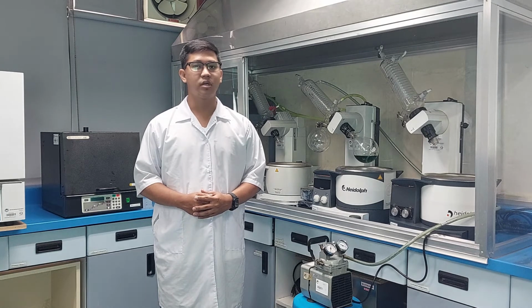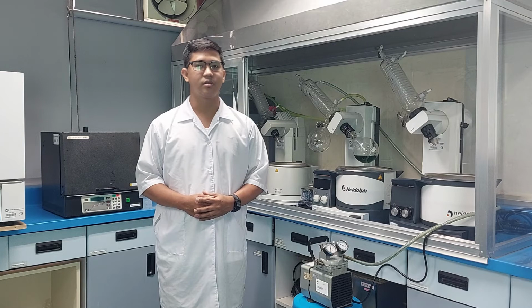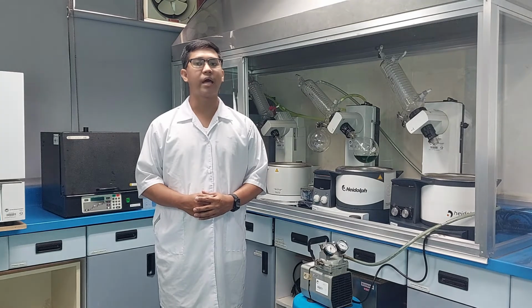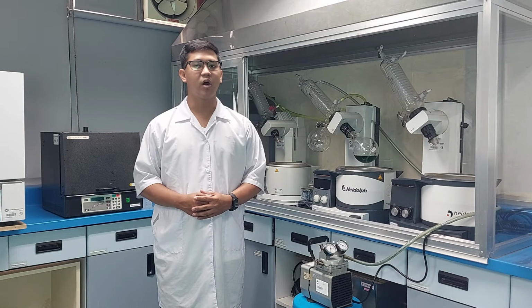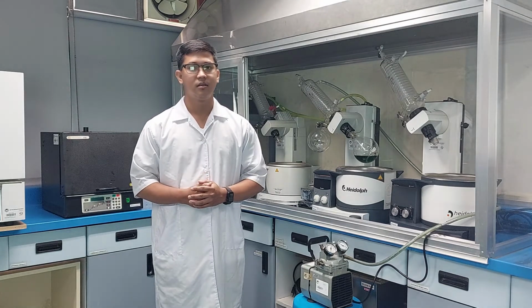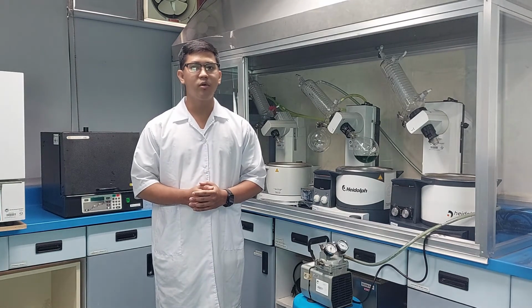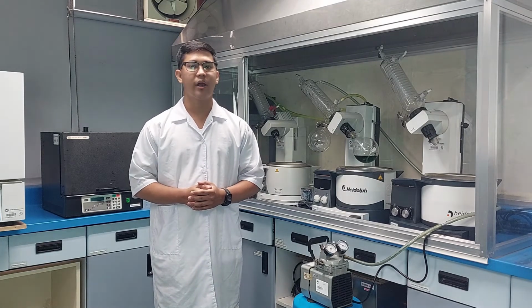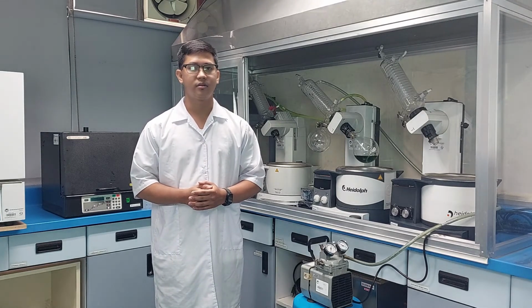The Teflon switches in various places cannot be tightened with excessive force, which can easily damage the glass. The interfaces shall not be screwed too tightly and shall be loosened regularly to avoid the death of the connector caused by long-term locking. Avoid leaving water in the heating bath. The best protocol is to remove and fill water regularly. Check glassware regularly for damage.